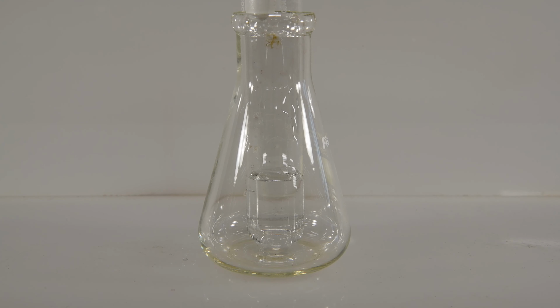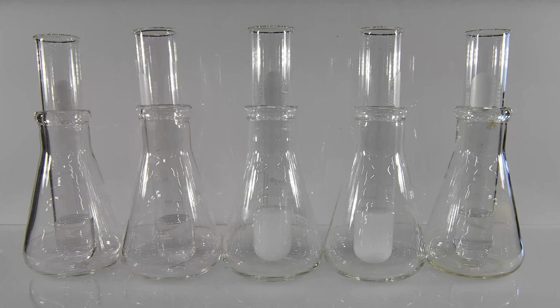And it appears that there was no reaction. Here are all 5 of the reactions with the sodium sulfate, and like the sodium hydroxide, the magnesium and calcium showed no reaction, as did the hydrochloric acid, but both the strontium and barium formed a precipitate.